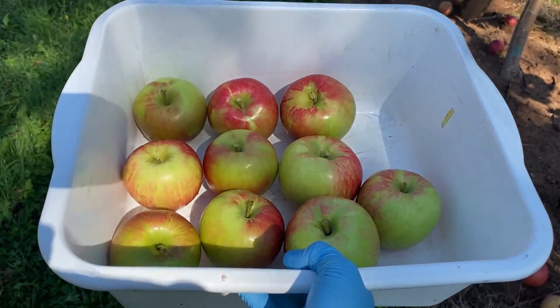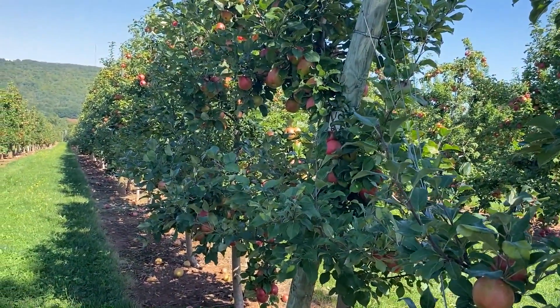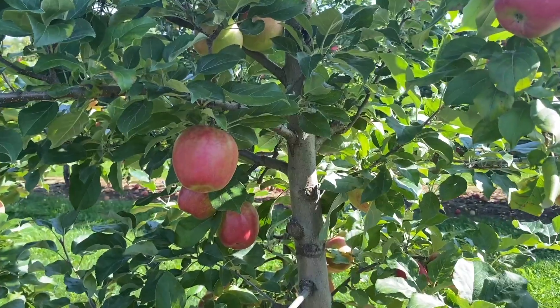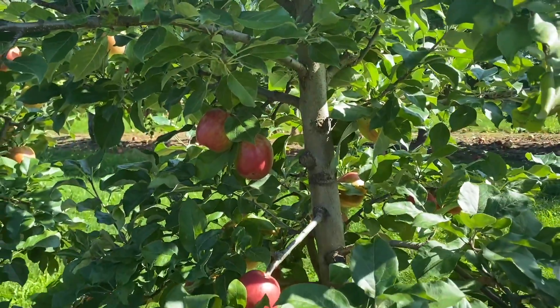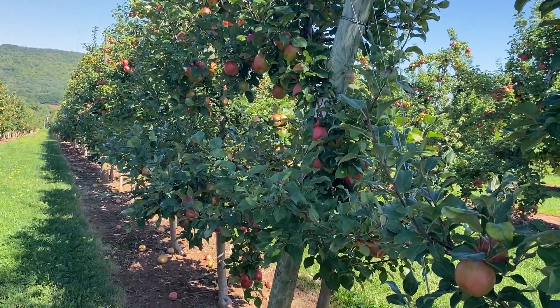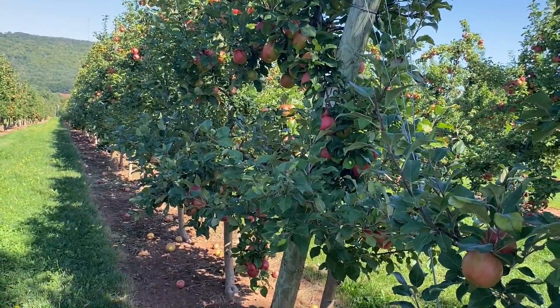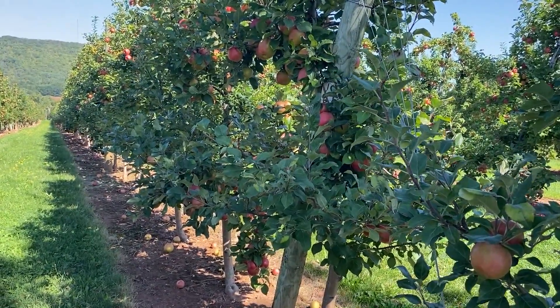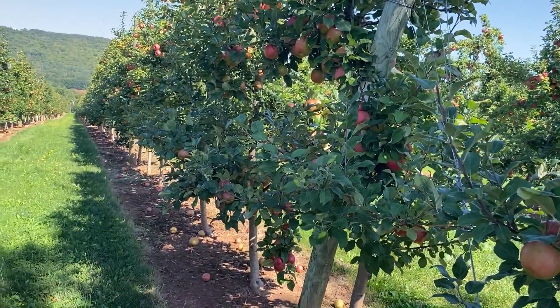I've got my 10 fruit sample and these are representative of the fruit in this block of this variety, which is Honeycrisp. What I did was selected these fruit from both sides of the tree and also from different outside areas of the tree, so these are representing what I would say our first pick apples, but I made sure to distribute this sample from around the tree.